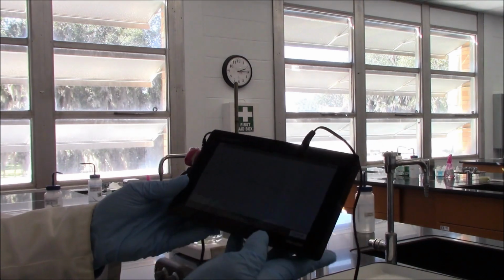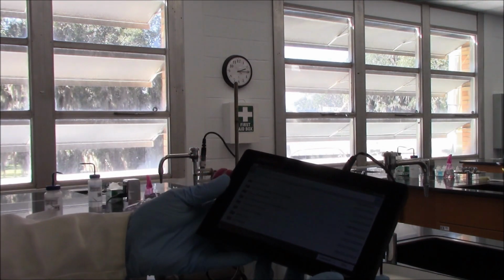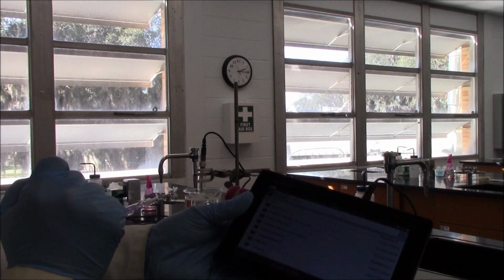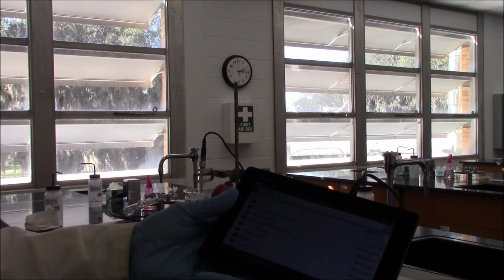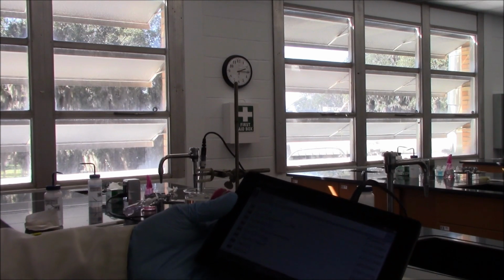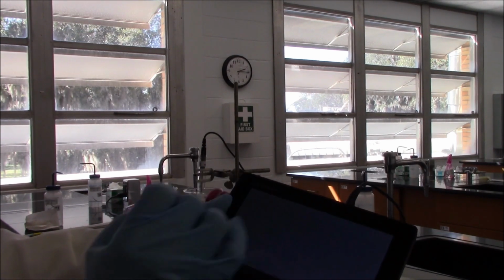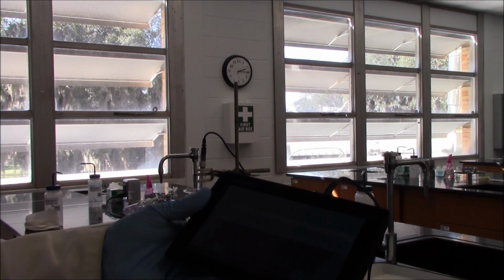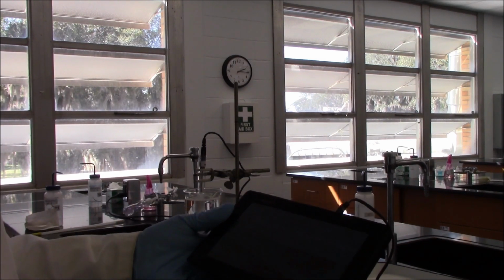Let's see what is happening here. Now the device recognizes the USB drive. We can see a lot of files and folders. All we need to do right now is click here. So then we need to give a name. You can name it whatever you want, and then maybe put down your name.